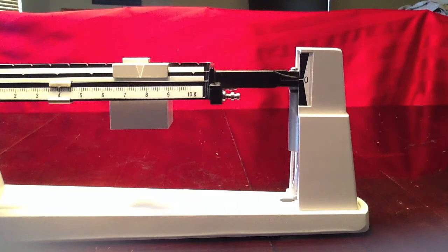We now have our balance lined up perfectly at the zero.